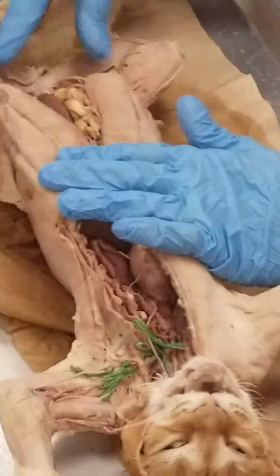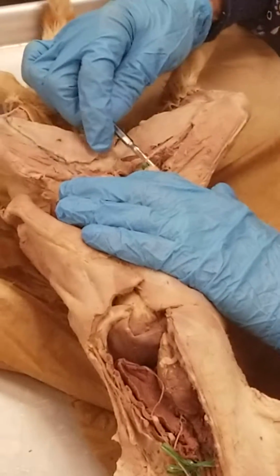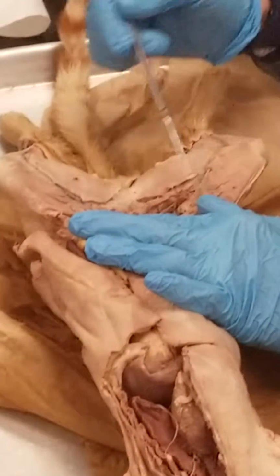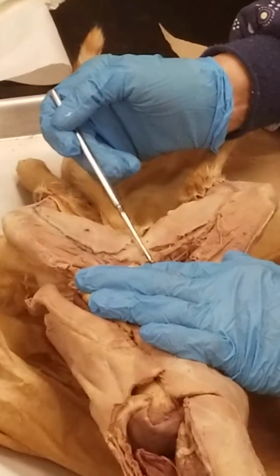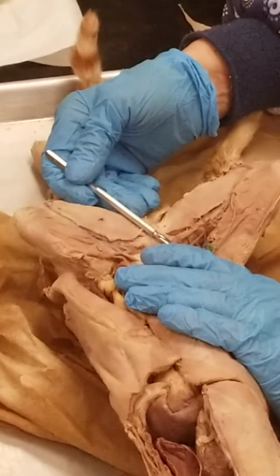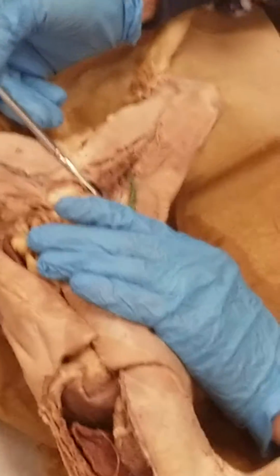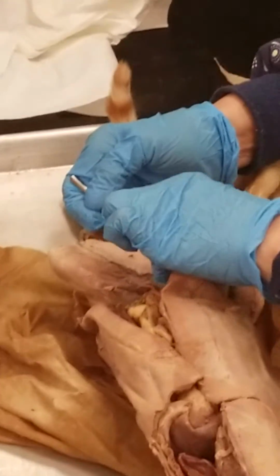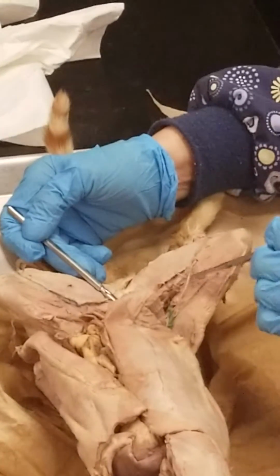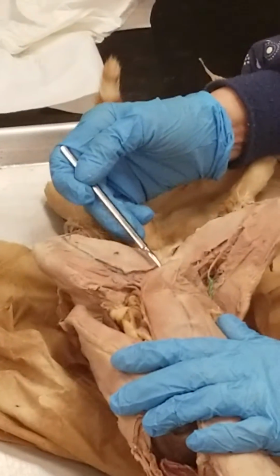We're going to see a couple of them down here in the legs. There's a very long, thin one here, runs the entire length of the femur. That's the femoral nerve. And then there's another tiny, teeny one way deep in the groin area here, way medially. And this is very tiny in this cat. It's going to be difficult to see. Look how thin it is. I'm not going to lift it too hard. It's just going to snap. This is the obturator nerve. So the obturator is going to be really close up here in the groin. And the femoral nerve will be this longer one that runs the entire length of the femur. Femoral nerve here, obturator nerve here.